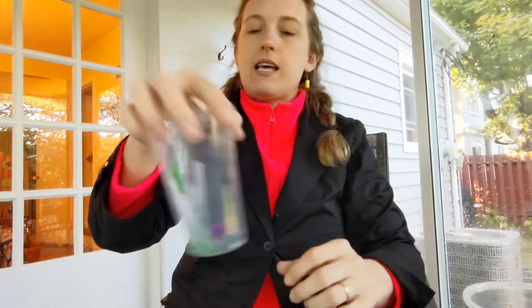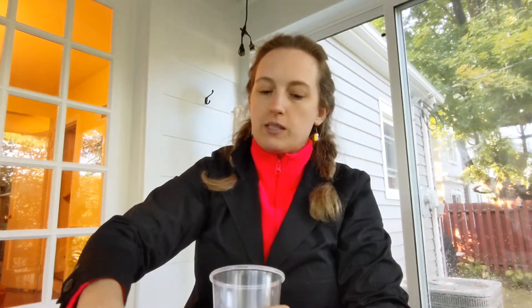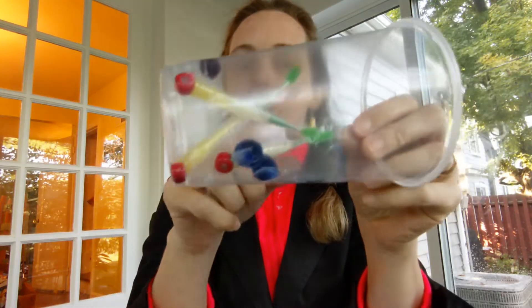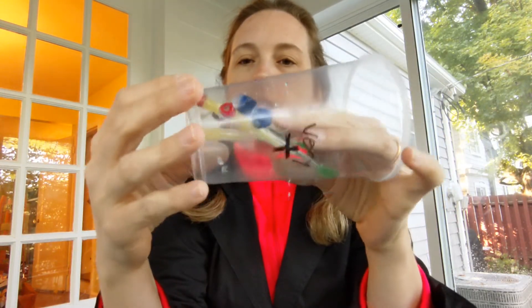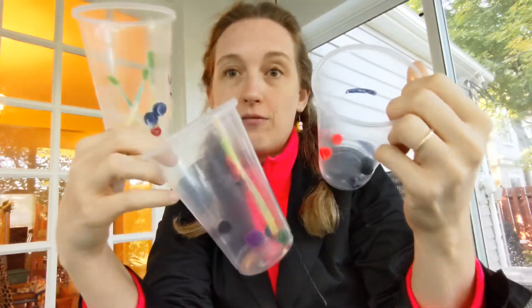Then we add the secondary antibody to the second sample, rinse with buffer — a little bit stuck, so it found the primary antibody. Then we add it to the third sample. After rinsing with buffer, there is our enzyme-linked secondary antibody. So the enzyme-linked secondary antibody is sticking to the primary antibody, which is sticking to the antigen. There's more of everything in this third cup, a little bit in the second cup, and none in the first cup — but we still can't see the difference yet.